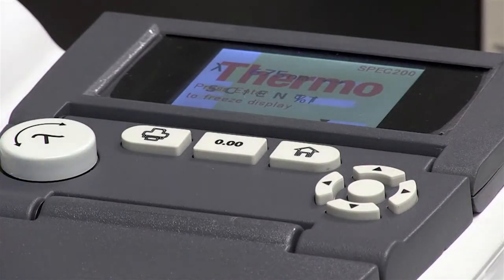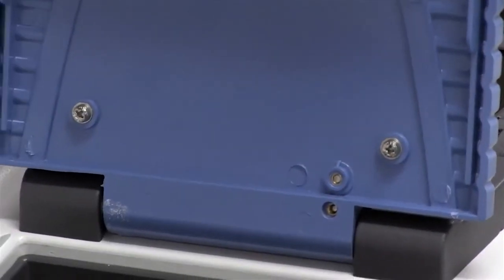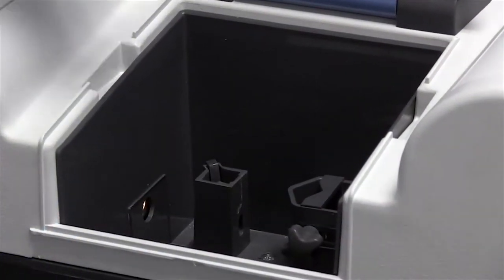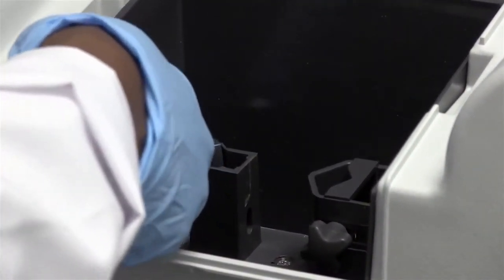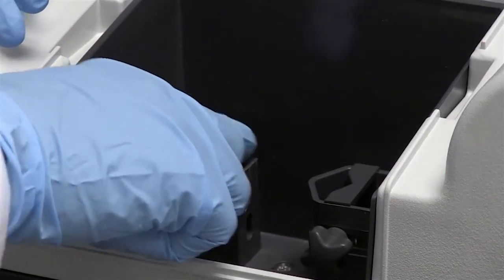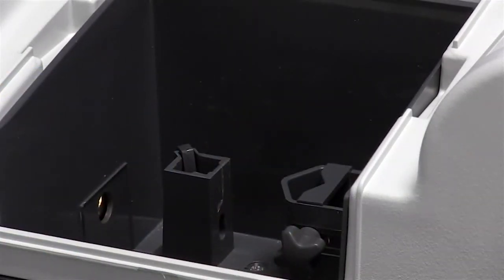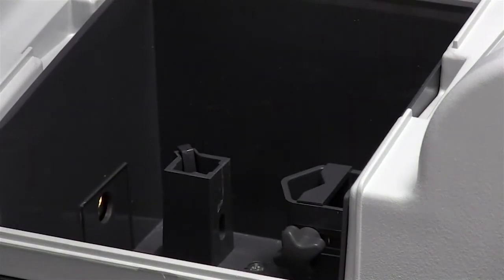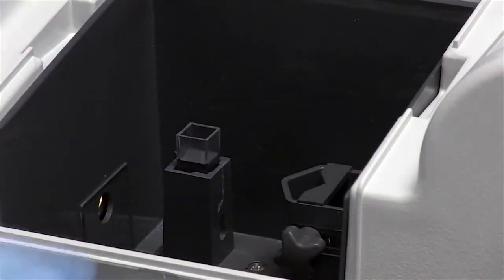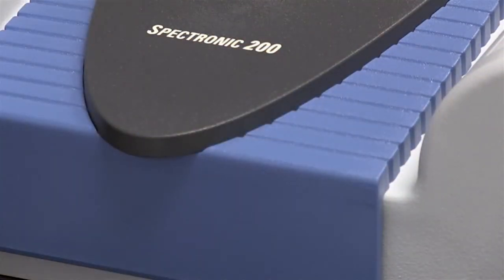Nothing is in our sample holder yet — I'm just showing you an example of where you're going to put your samples. Inside the spectrophotometer there's a light source right here. This light source sends light from the monochromator and it hits your sample, which can either be placed in the cuvette holder or in the slot for a test tube. I have a cuvette here — I can put it in and you'll notice it fits very snugly into the cuvette holder, and then I could press enter.